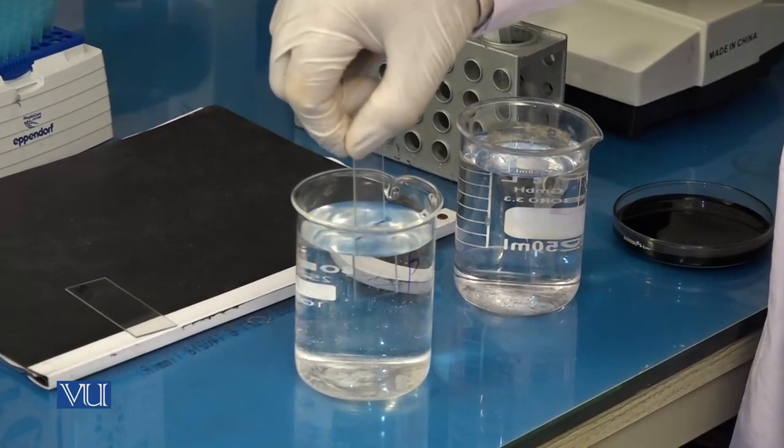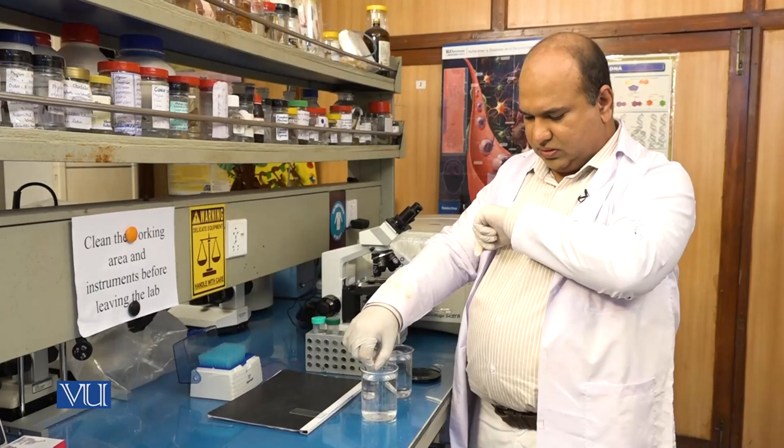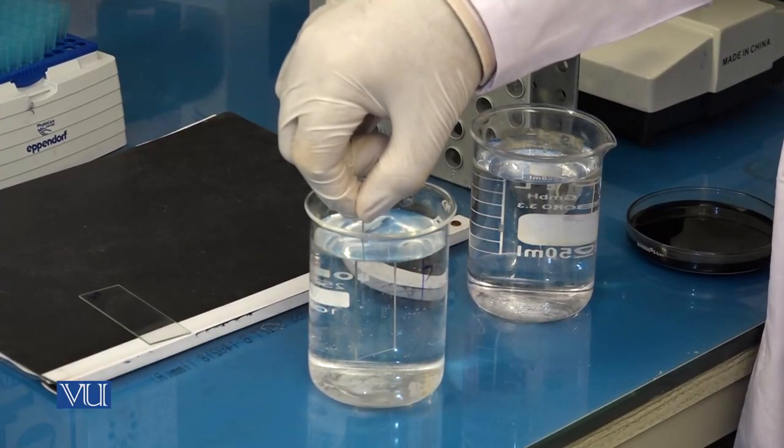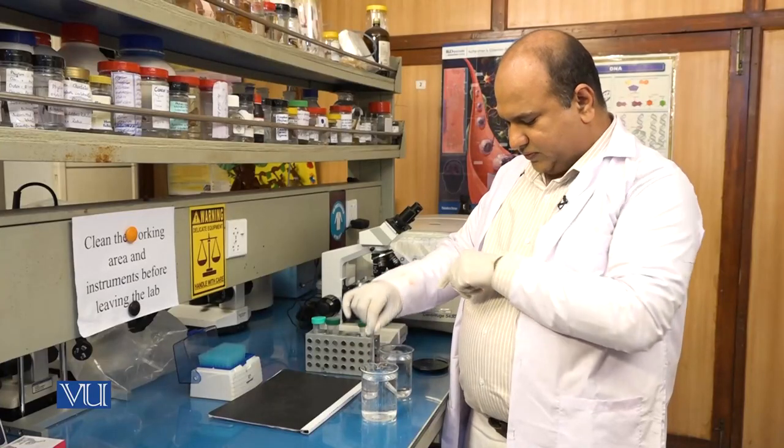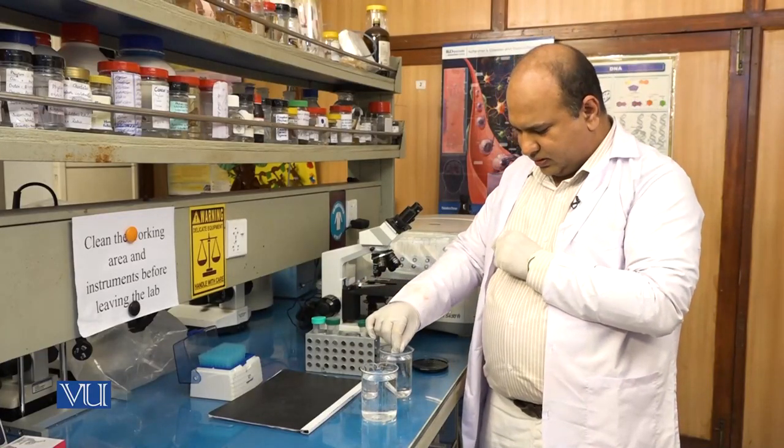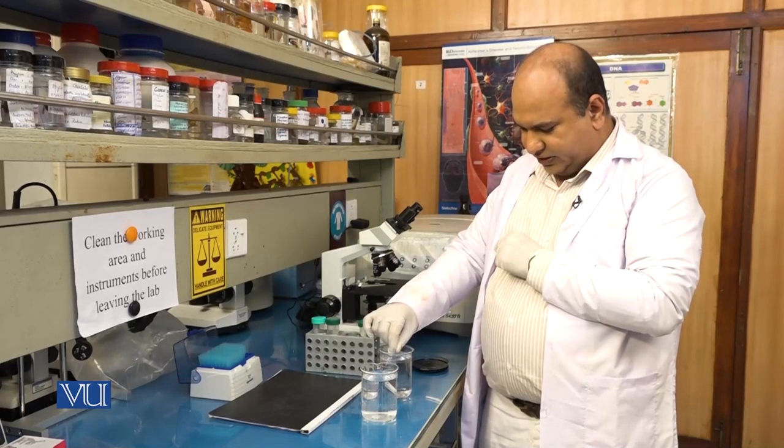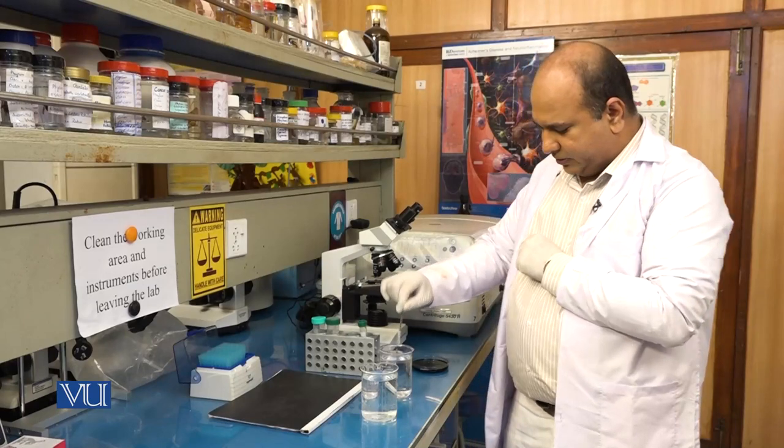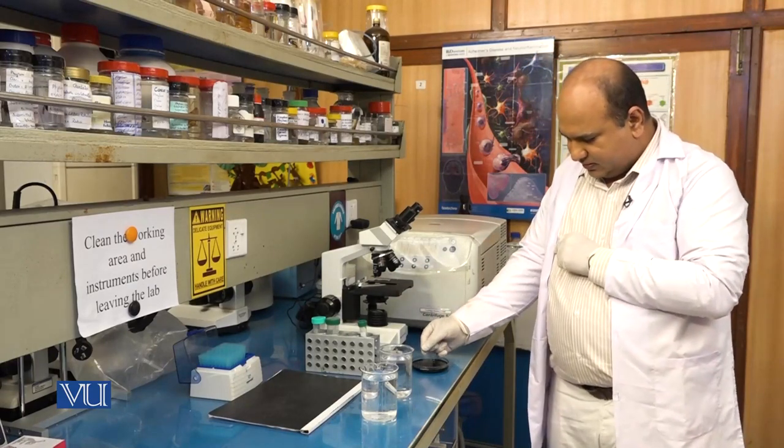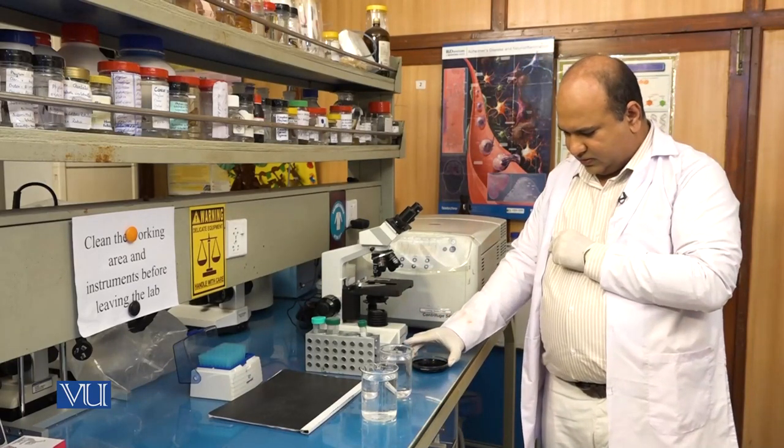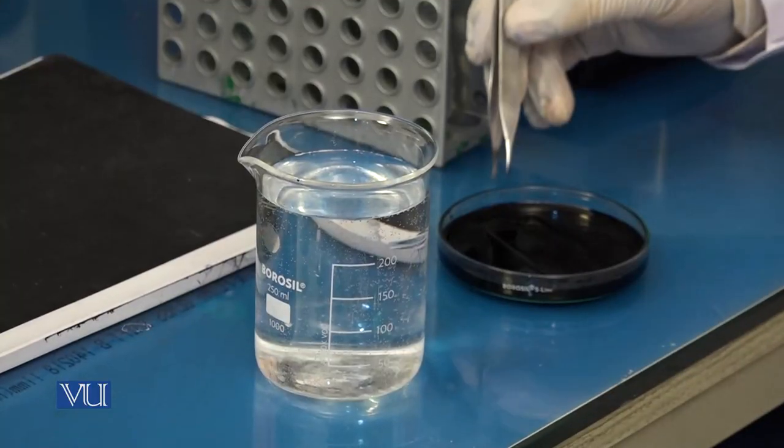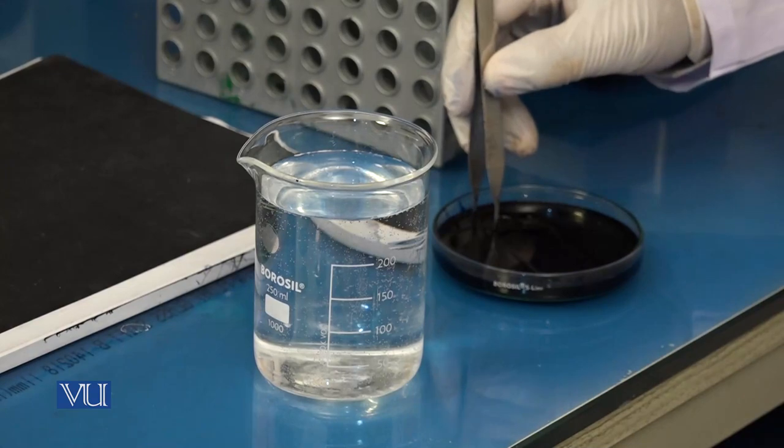Now I dip it in the buffer. Now after the treatment with the buffer, I am dipping it into the Giemsa. So for three minutes I will dip it in the Giemsa.